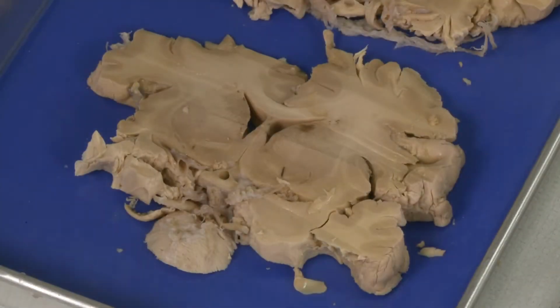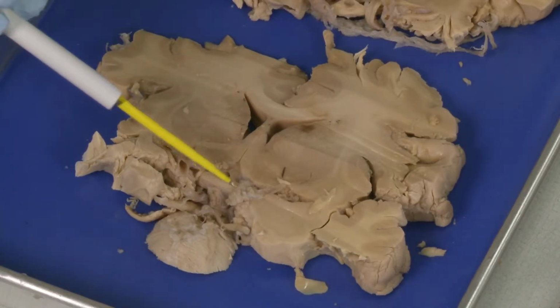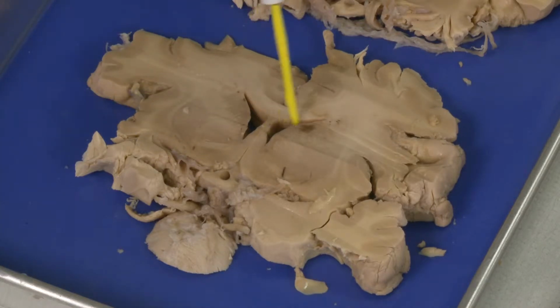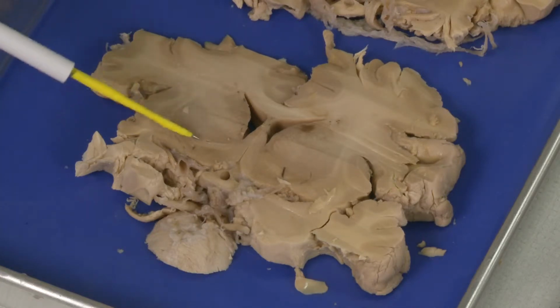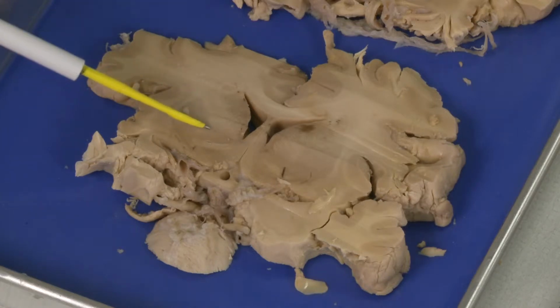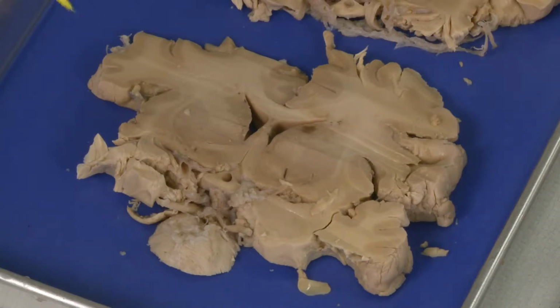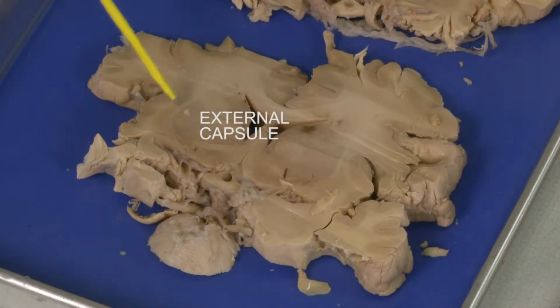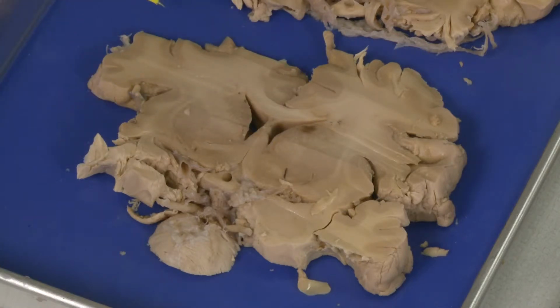So this is the next level, and this level is actually pretty nice because you can see optic chiasm better than in the previous level. You can see very well lateral ventricles, internal capsule, caudate nucleus, putamen, globus pallidus, anterior commissure. And what I will point out here, which I didn't point out in previous sections, are also two white matter structures, external capsule and extreme capsule, which separate basal ganglia from the rest of the cortex.